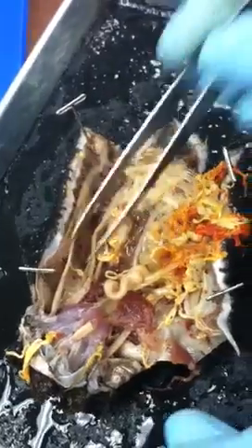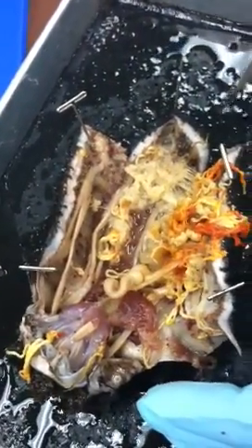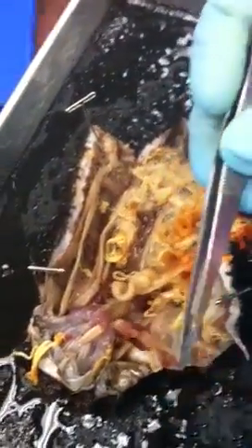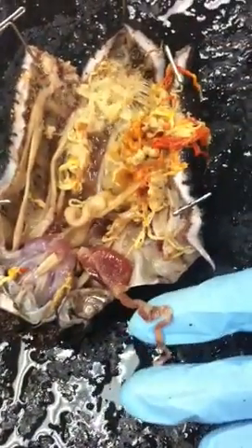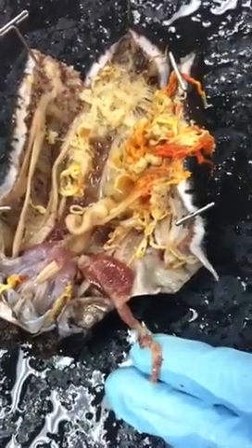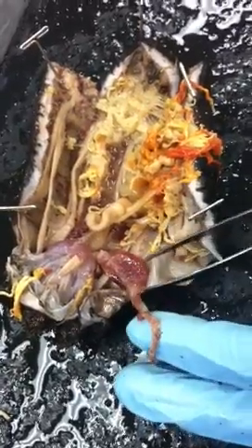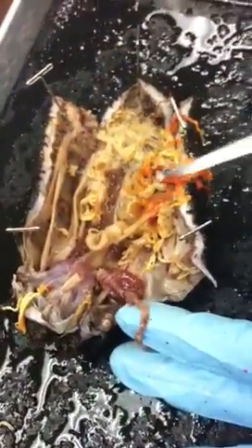Okay, so the water vascular system, on the starfish model, there's this little weird 3-lobe structure that's in between the arms, and it's called the Polian vesicle. And that is this gigantic thing here. Oh, no, you're fine. It is giant. That right there. And it's like a membranous sac. Right, so its function is just storage of extra water in the water vascular system.